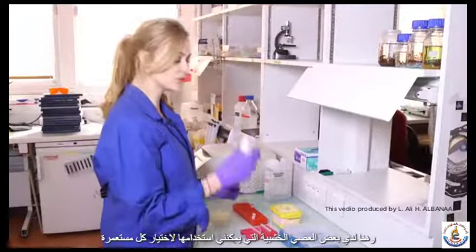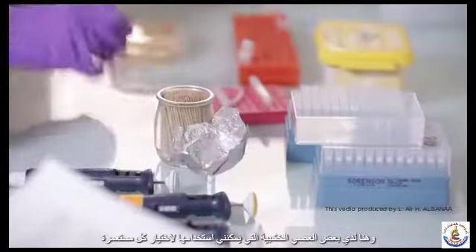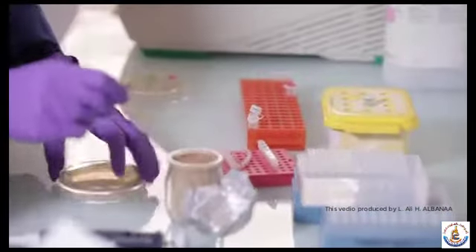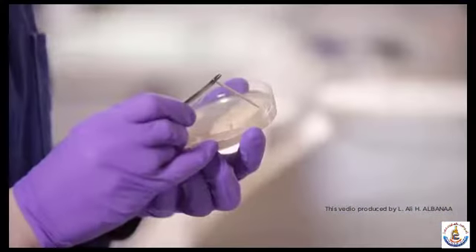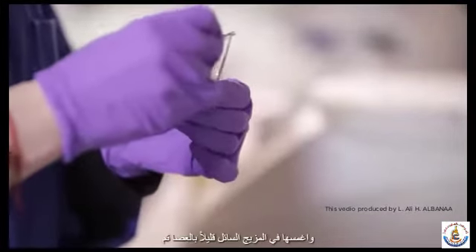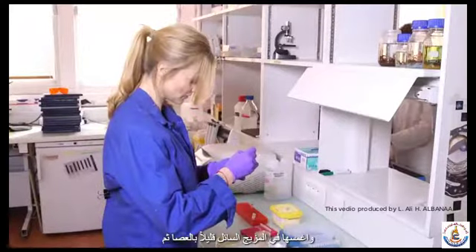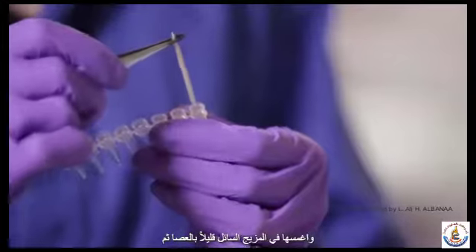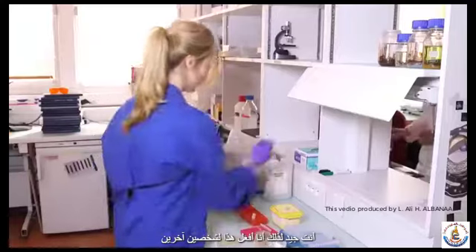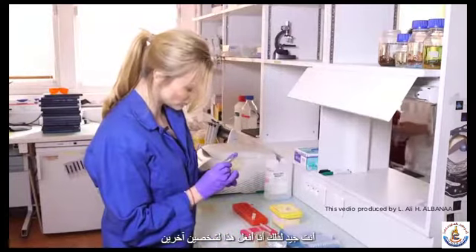And here I have some wooden sticks that I can use to pick each colony. And just dip it into the liquid, mix a little bit with the stick, and then you're good. So I'm doing this for 2 other ones.